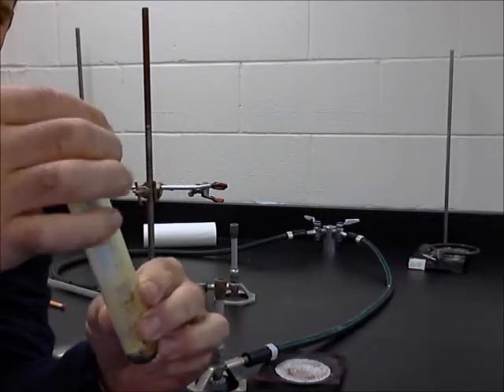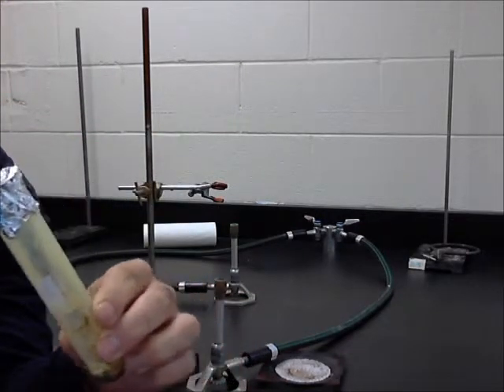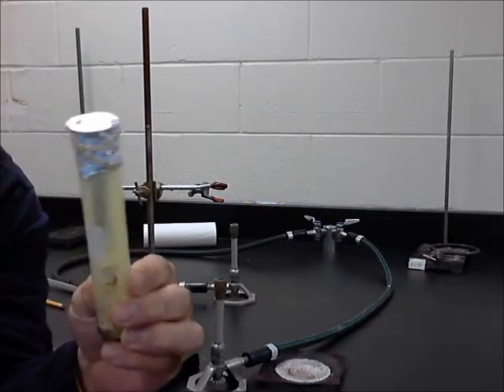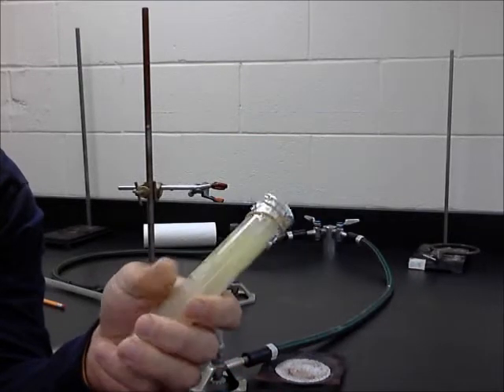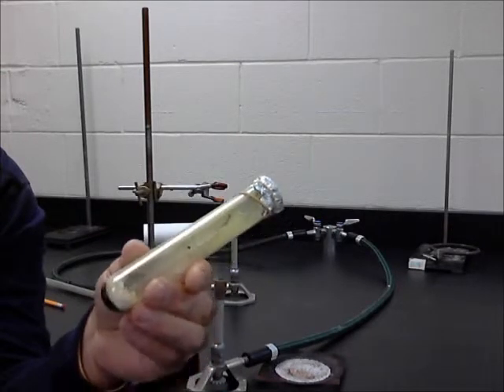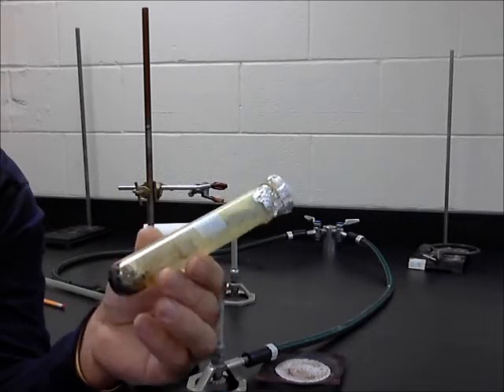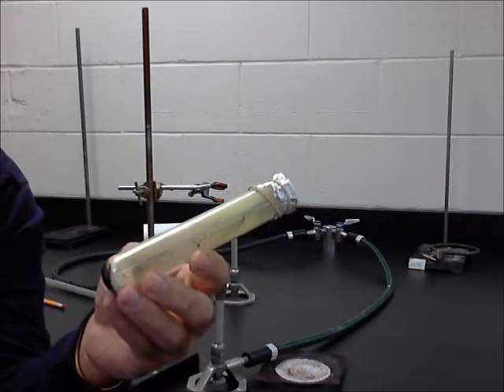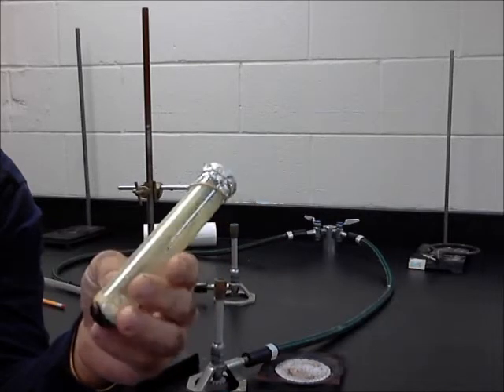Now, I'm not exactly sure why we cover this, but some classes don't, I've seen. It's a basic attempt to keep some of our stuff in the test tube, some of the gases. Occasionally the pressure builds up and pops this little aluminum foil off. See, it's dirty already from the previous experiment, but that's fine. Sometimes we have to break these to get the stuff out anyway, so we like to reuse these as much as we can. They don't clean up real well, so it's good to go.